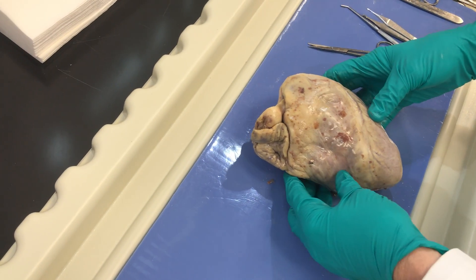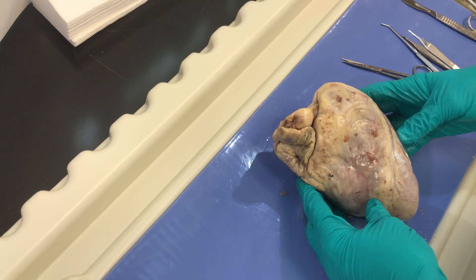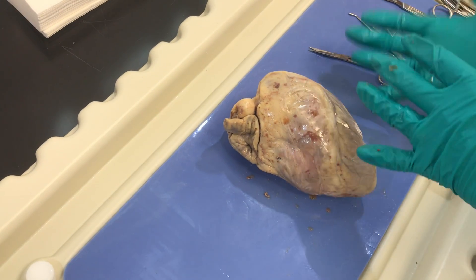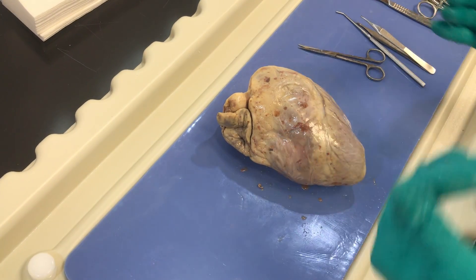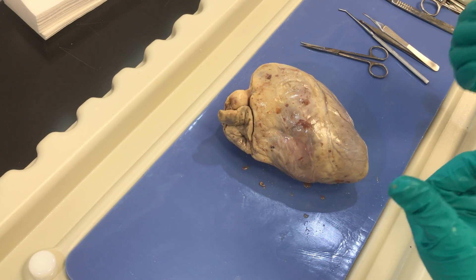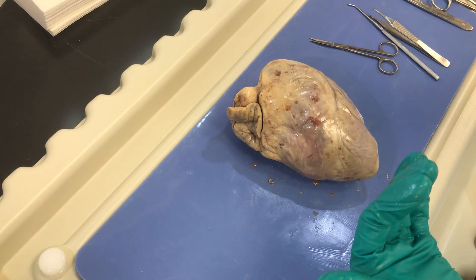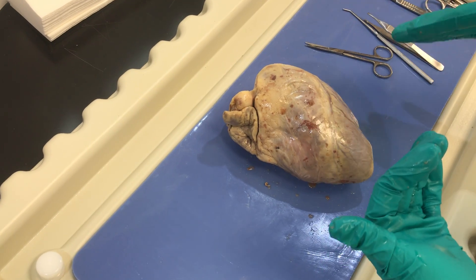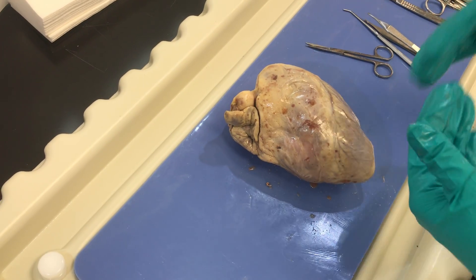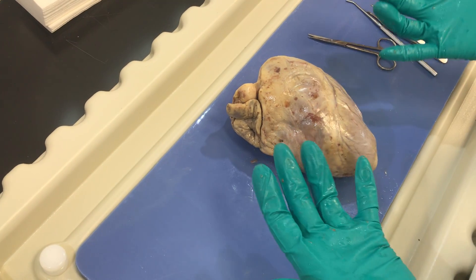Hello students. Today we're going to be looking at the structure of the heart, and it's really important to orient yourself before you start to cut into the heart to know where your structures are. When we do the dissection today, I'm going to cut through along the flow of the heart — we're going to go in that direction of blood flow.